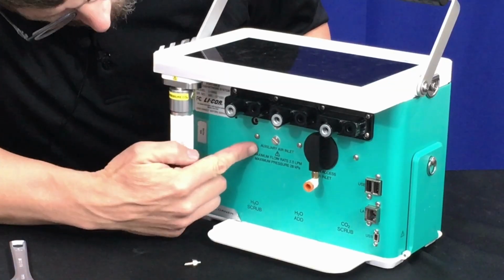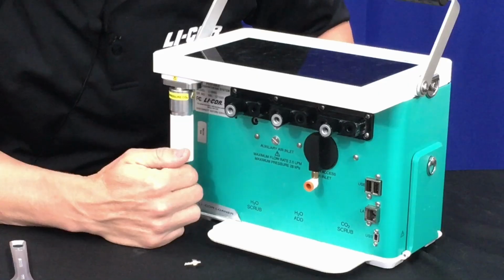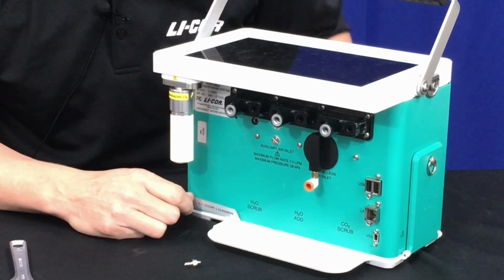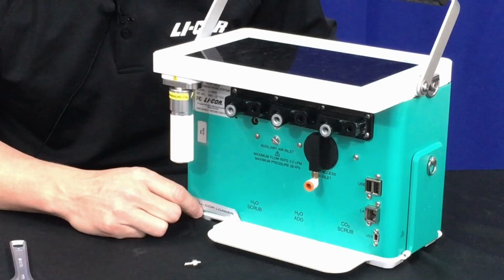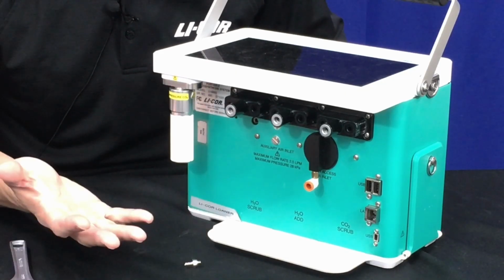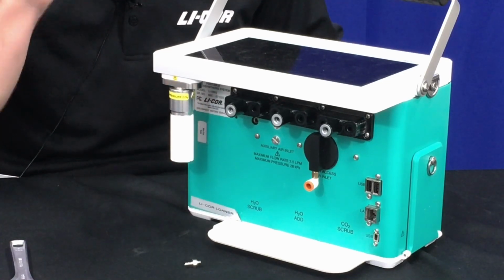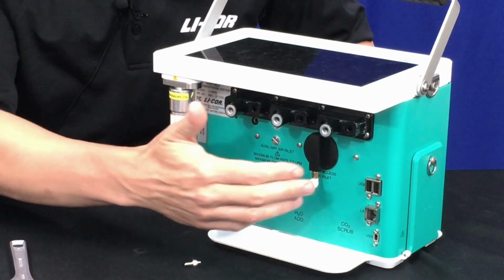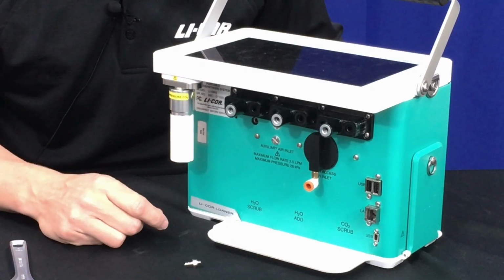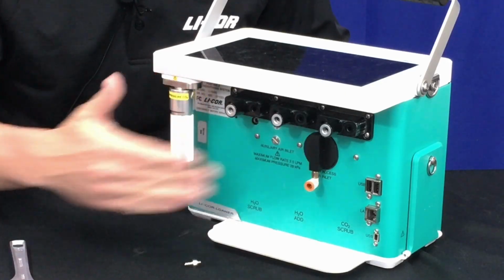Okay, so this is a closer view of where the plumbing changes occur. So let's start with if you choose to use the auxiliary air inlet, where you have a clean tank supply of likely CO2 free, or at least a constant CO2. And I should mention that in either case, you still have access to the CO2 injector and can control CO2 concentrations as you normally would, no matter which plumbing option you choose.